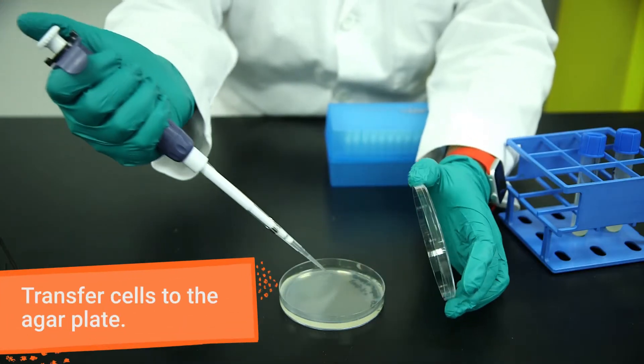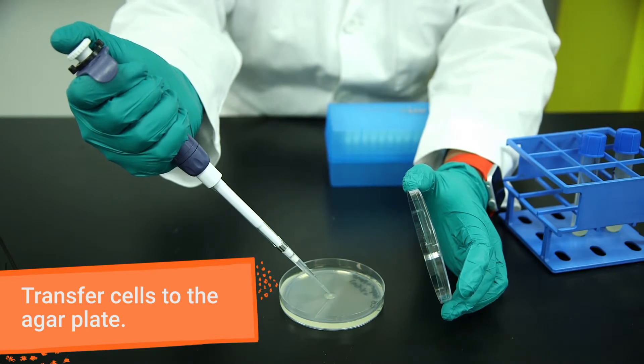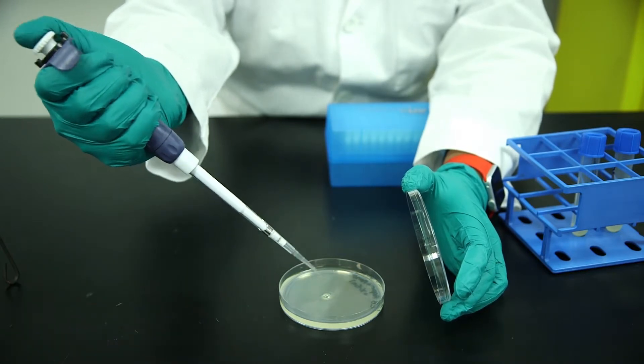To begin, transfer 50 microliters of cells to the appropriate agar plate using your pipette.